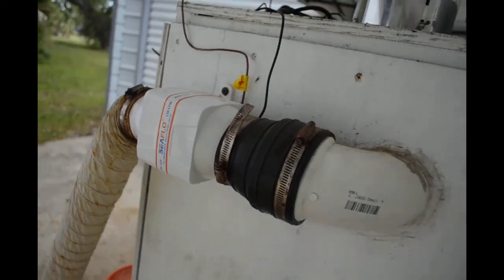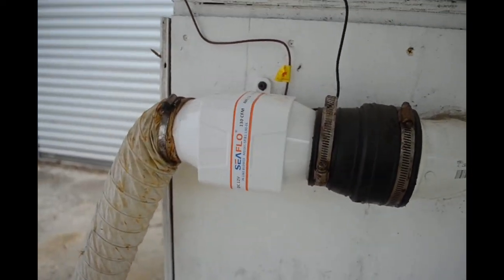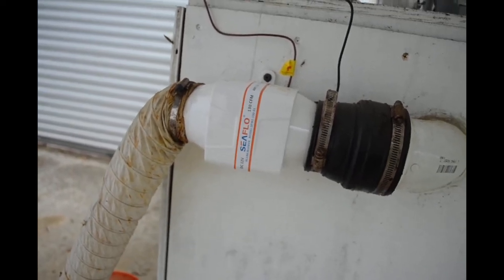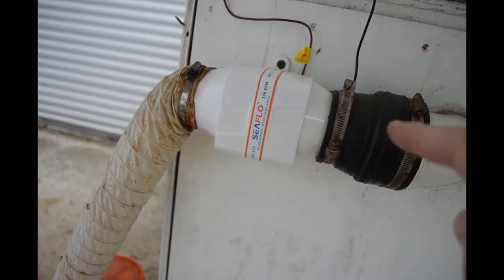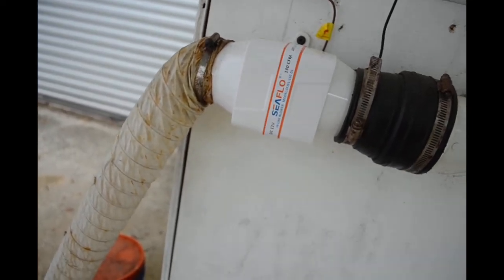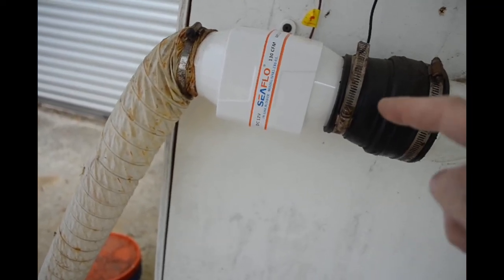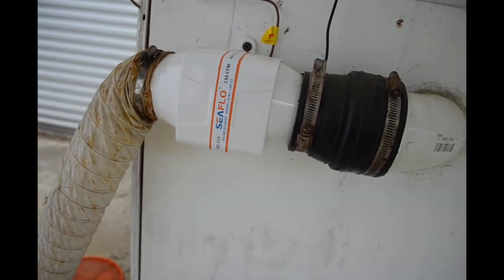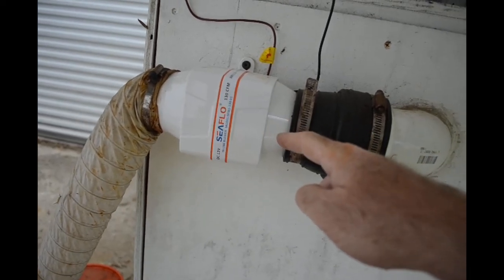Even though this works a lot better than the original blower, I do still consider this to be a consumable item. I get maybe six to eight months out of one of these. Even though it's all sealed, eventually all the nastiness going through here will destroy the motor or destroy the bearings or destroy the blades on the fan.